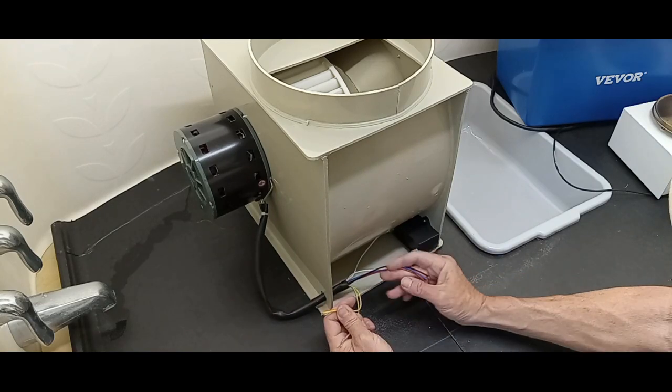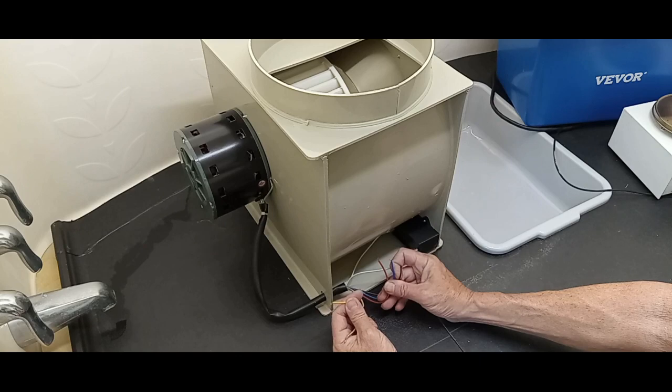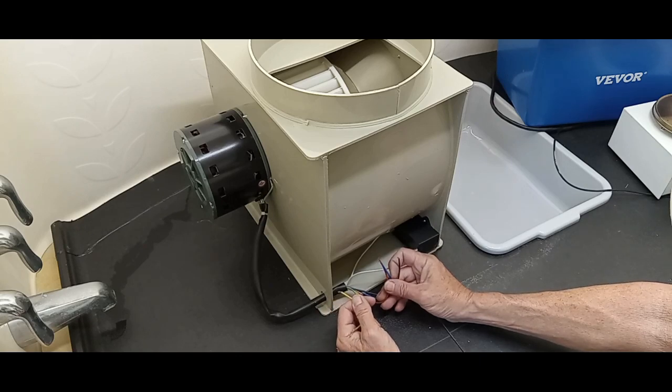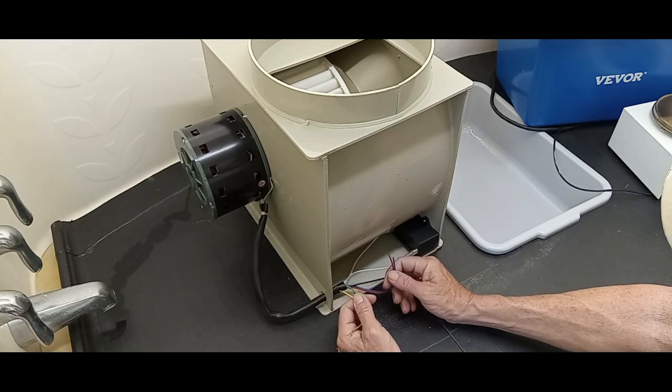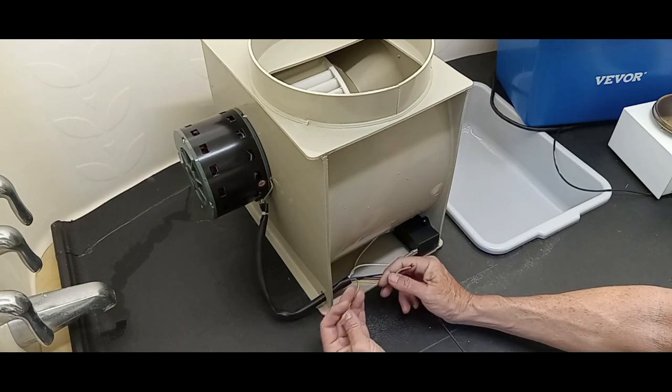Here's your line coming in, and then you tie black, blue, or red, high, medium, and low, to the other side of your 110 line. And there's your ground.